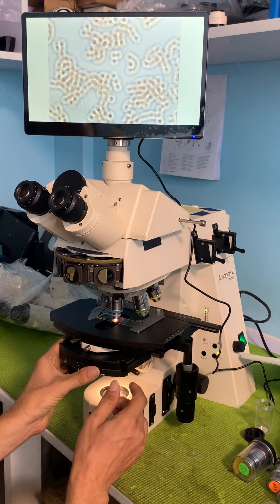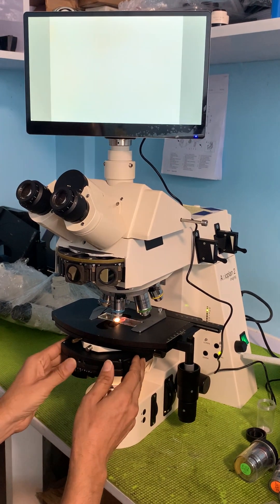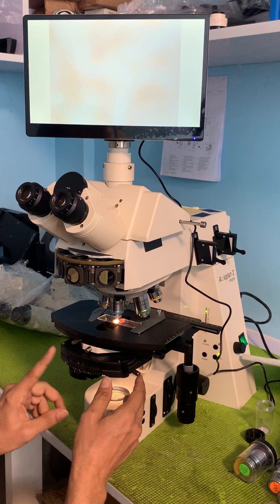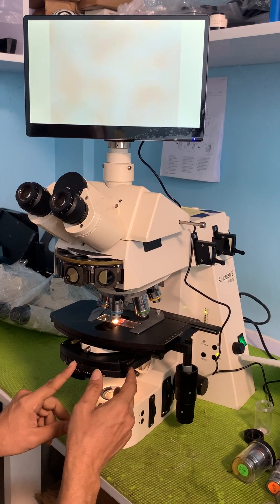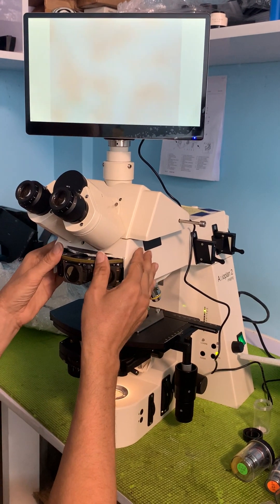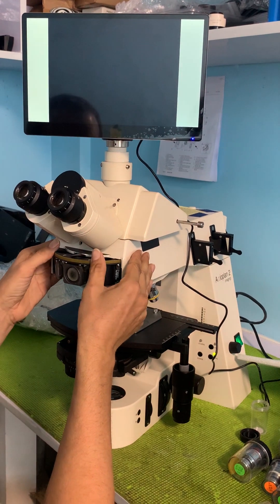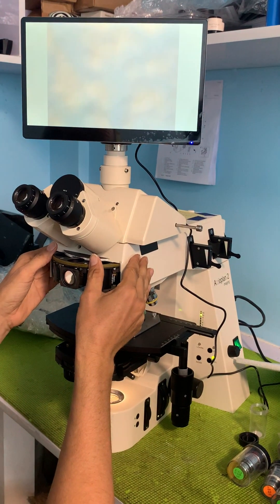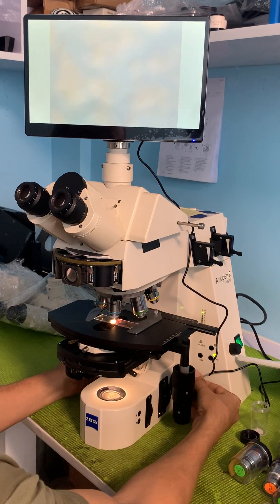Now I'm going to rotate my condenser so that I have my DIC prism in the condenser, and I'm going to rotate the cube turret so that I've got my analyzer in place.